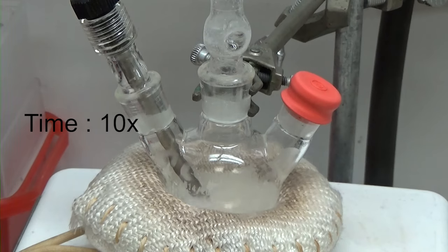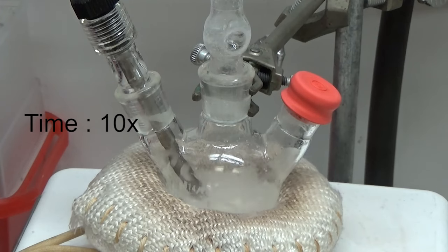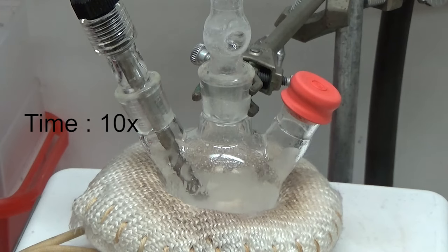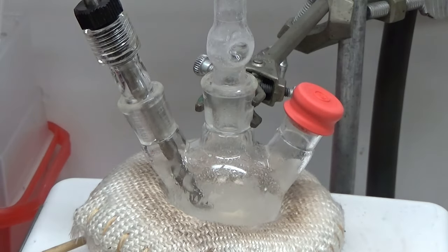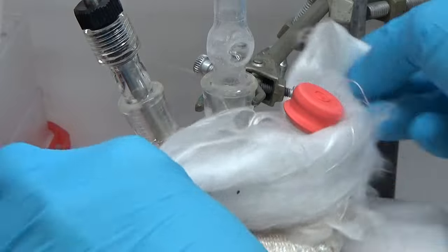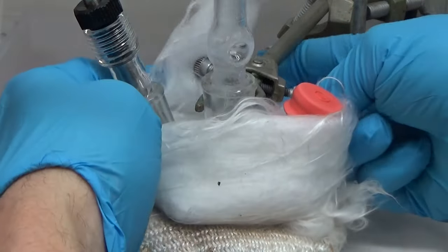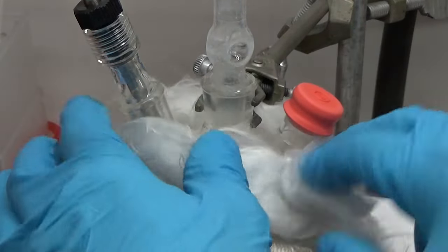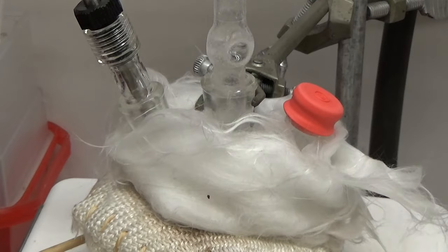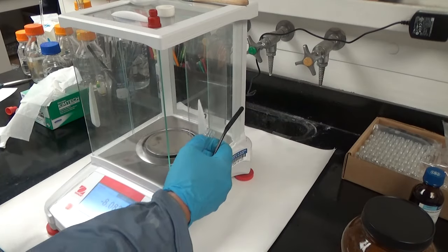Here we're heating up somewhere 80, 120. And at around 80 degrees, you can see that the acetic acid is coming off and you see a burst of bumping inside of the solvent. Now we never fully convert the zinc or cadmium acetate to the oleate at these temperatures. So what we have to do is we have to heat it up to 220, usually 220, maybe 250 for about half an hour, cool it back down and do the vacuum again.